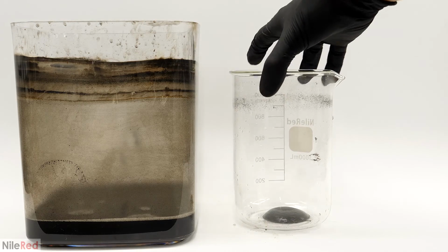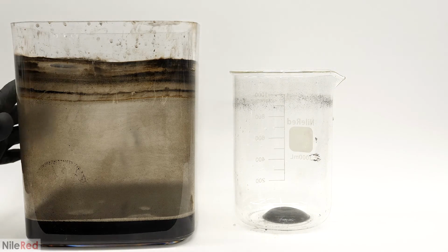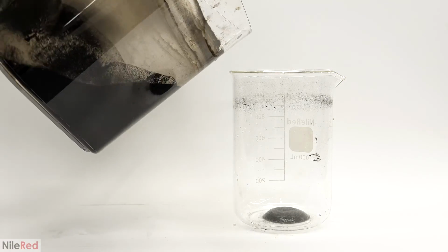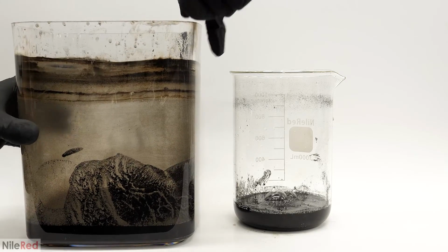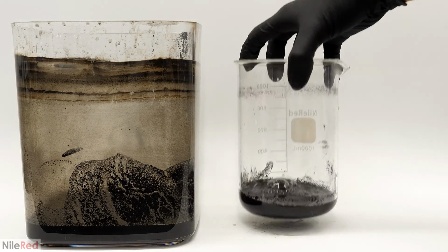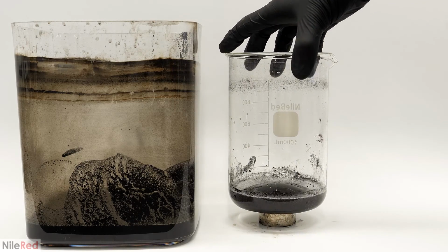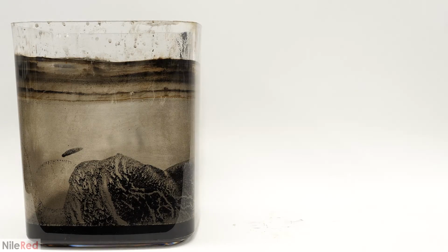The goal now was to separate all the magnetite into roughly 3 equal portions. Ideally, I would have just done it as one large batch, but the strongest magnet that I had wasn't strong enough to hold this much magnetite. What I had in the beaker at this point was probably the max that this magnet could handle. So once it had separated, I took it away, drained off the water, and I got a new beaker.